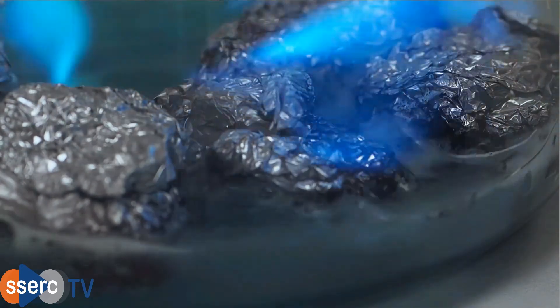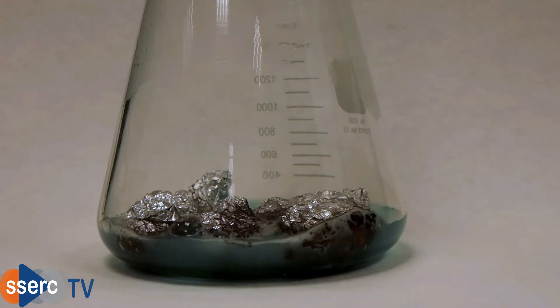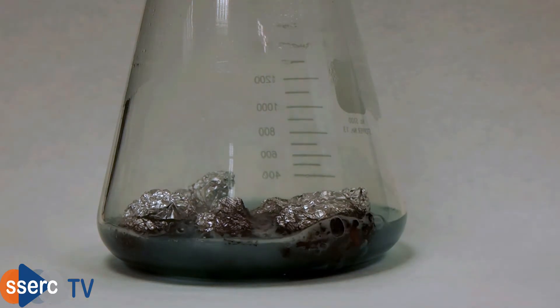So what's happening here? There is clearly a displacement reaction going on between the aluminium and the copper chloride but there must be more than that.